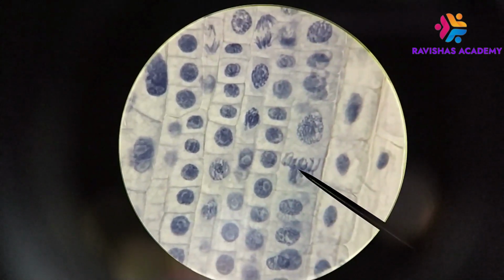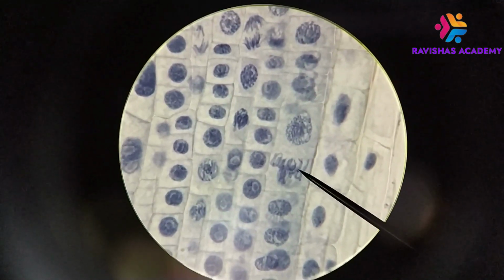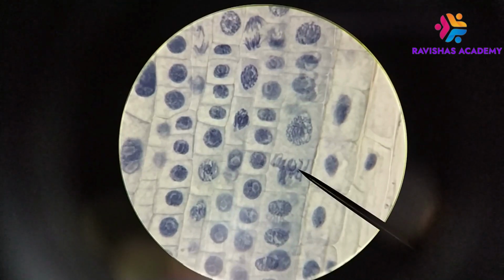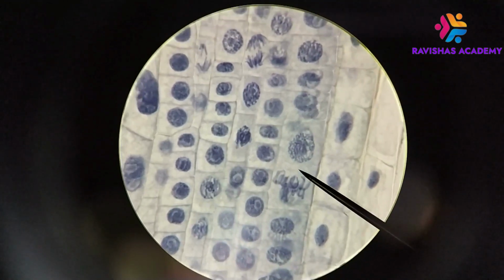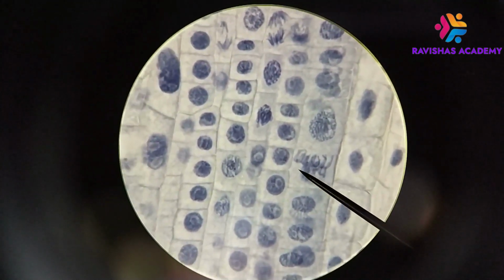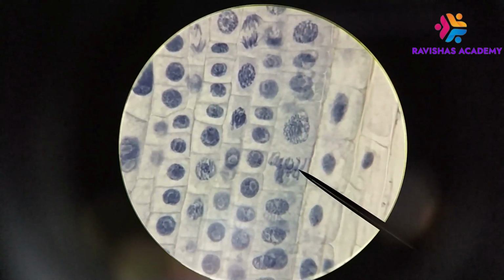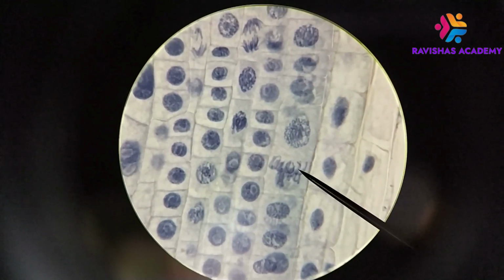Now, after prophase, the next stage is metaphase, and what you're seeing here is that the chromosomes have actually been pushed towards the middle. So right now, what the pointer is pointing at is the metaphase plate. So it goes across horizontally in this case. And so what you see is that the chromosomes have been pushed together into the middle region. Okay, and now because they are long, they still have little strands poking away towards the poles, but the midpoint of the chromosomes, the centromeres, have all been pushed into the middle, and they've been caught by the microtubules, and they are getting ready to separate.